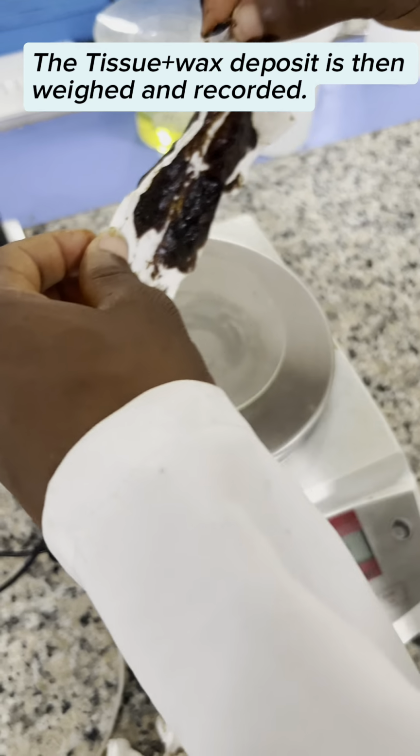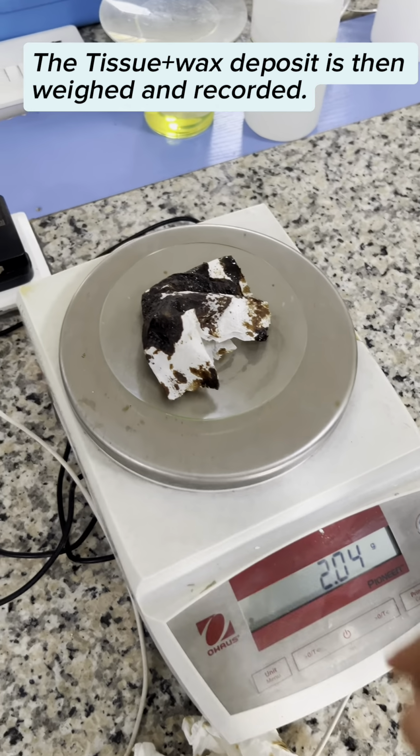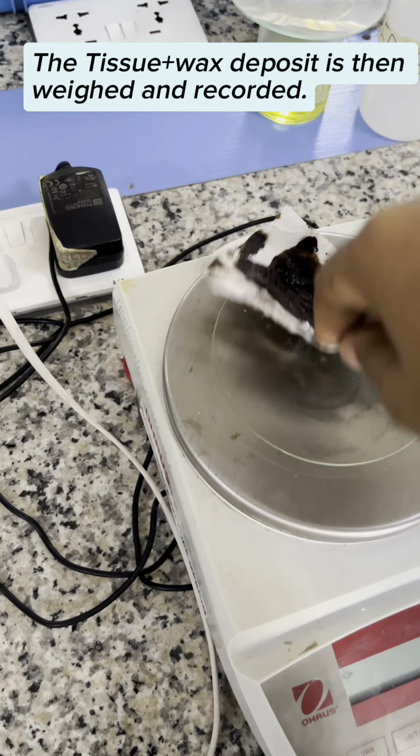The wax and tissue deposit is then weighed and recorded, and this process is repeated for the various temperature ranges required.